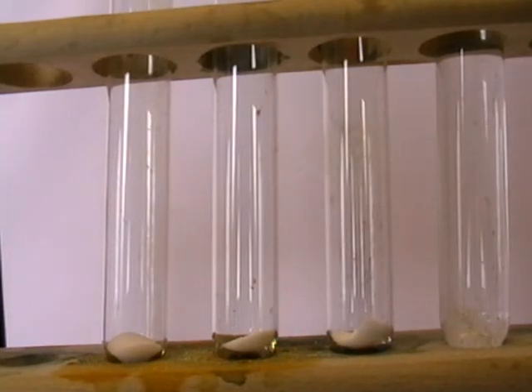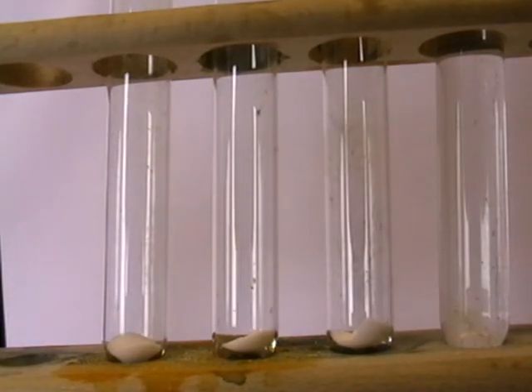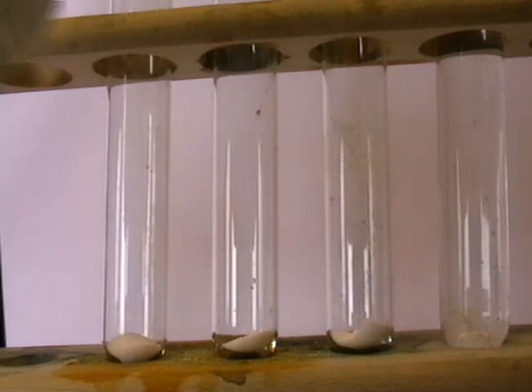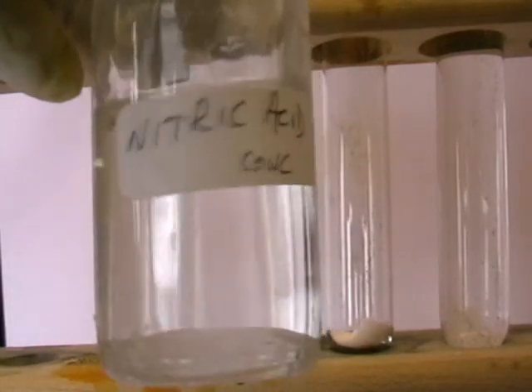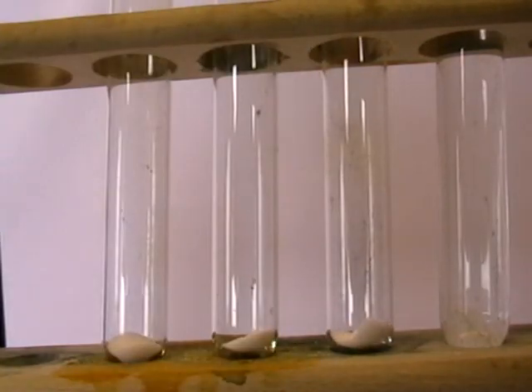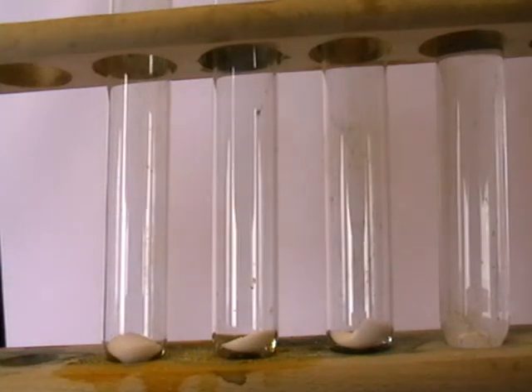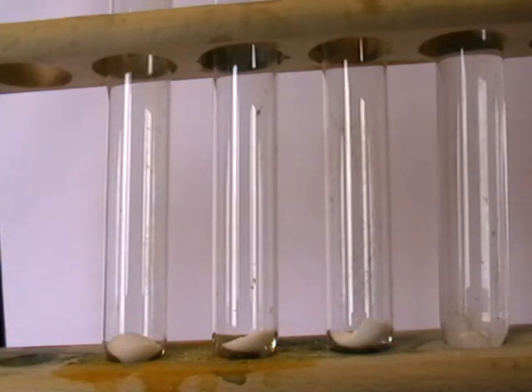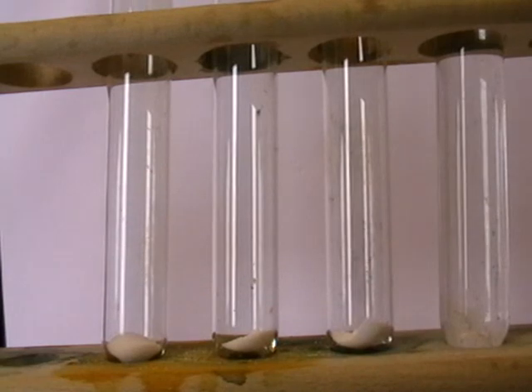I'm going to acidify the silver nitrate. This test works with acidified silver nitrate, and I'm using concentrated nitric acid, just adding a few drops to the silver nitrate. There they go. So on the right we've got acidified silver nitrate.